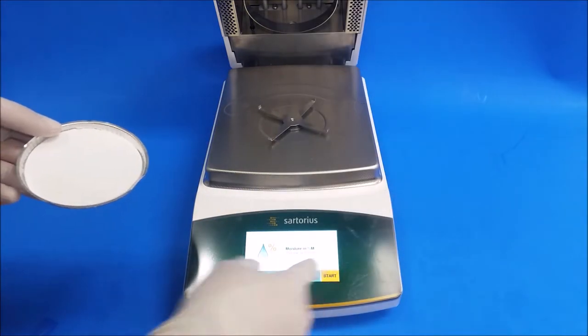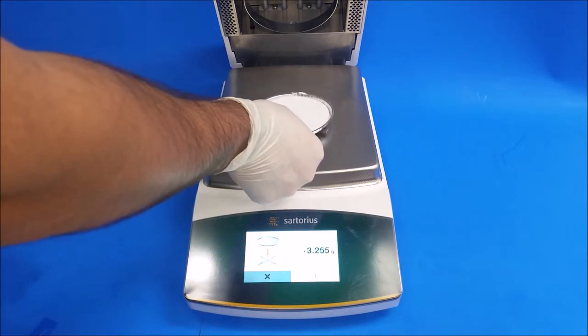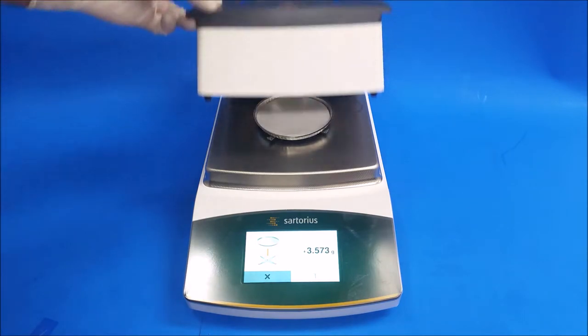We're going to hit the start button. We're going to put our dish and two pads. Close the hood.